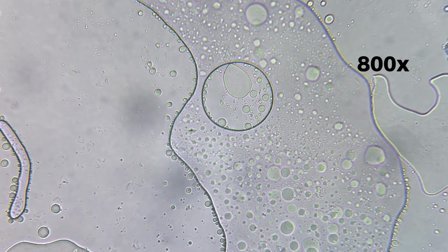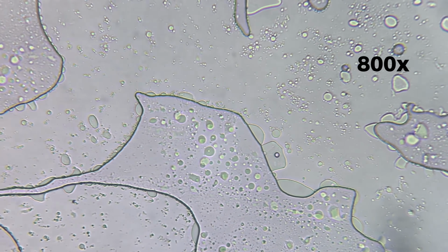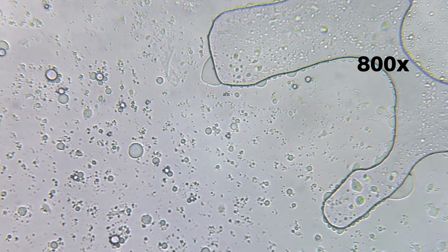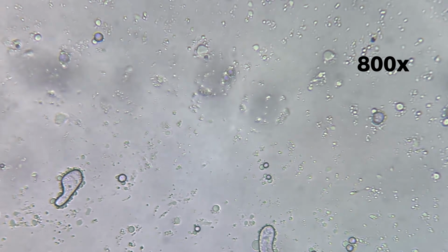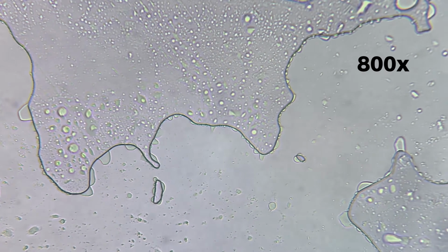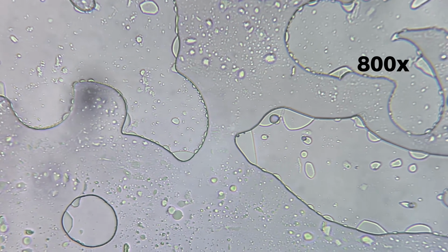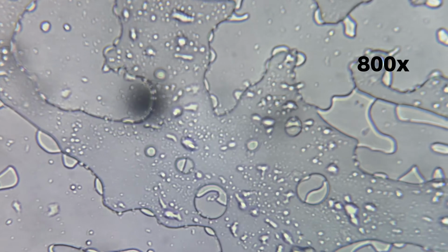The surrounding area looks textured and granular, filled with countless tiny particles. This contrast defines much of the avocado's internal structure. The avocado no longer appears as a single substance. It looks like a combination of different components interacting closely with one another. Some regions appear tightly packed, while others remain looser and more open. This variation adds complexity and depth. At this scale, the avocado begins to resemble a microscopic landscape rather than food.